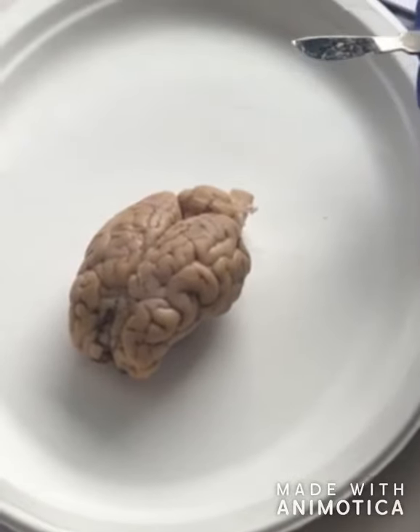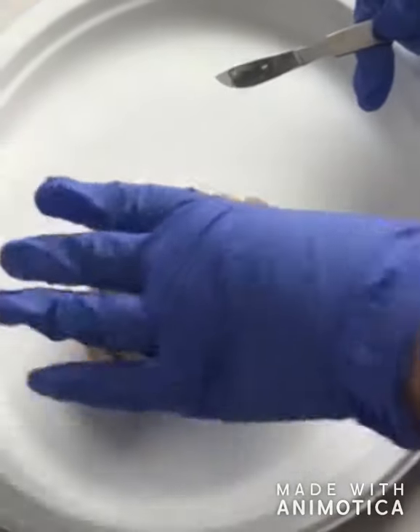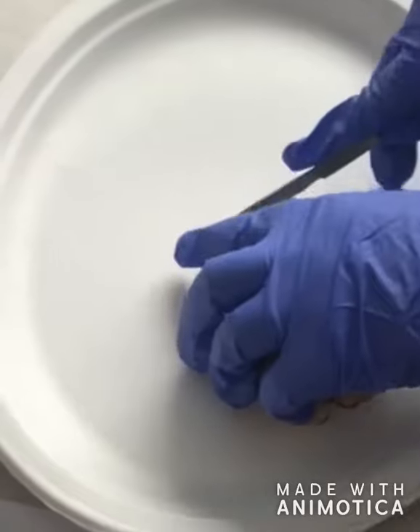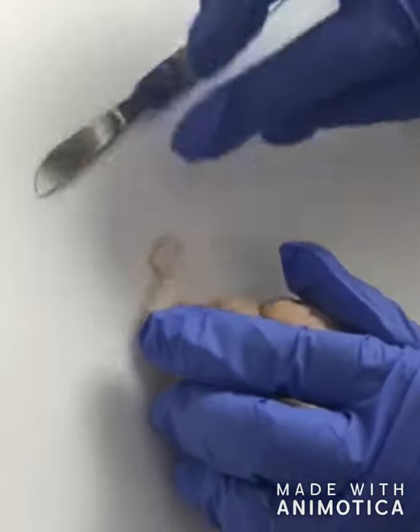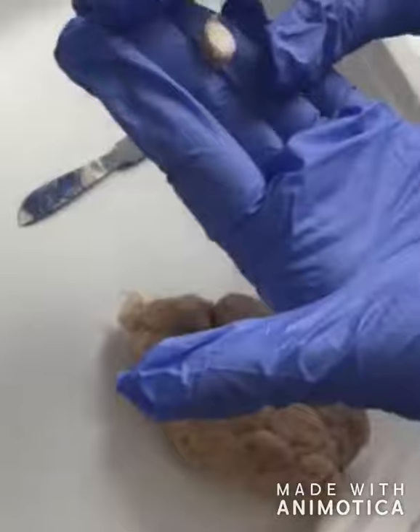This refers to the cuts made to the spinal cord, and basically it's like you're cutting a salami. You're just going to cut right into that. So it's going to be a transverse cut right there.